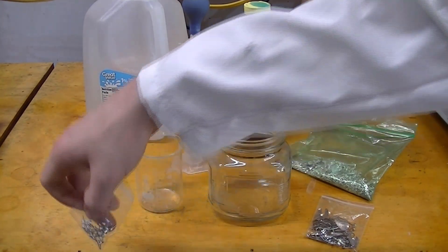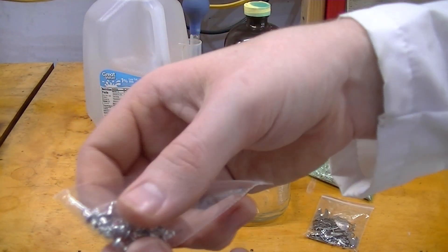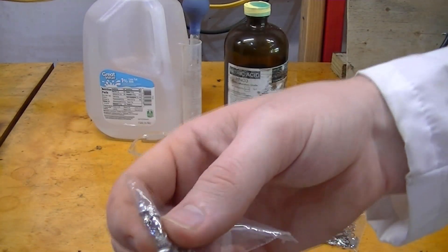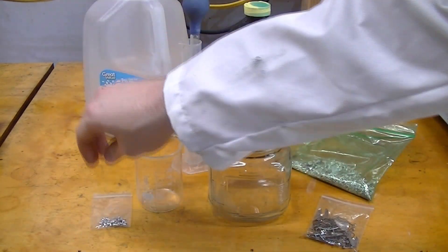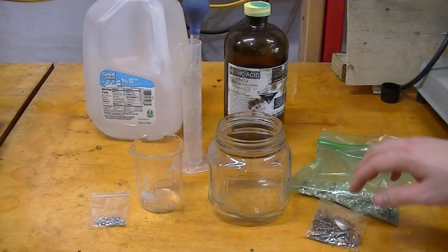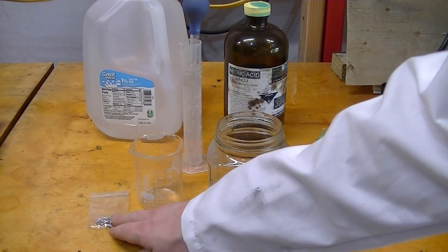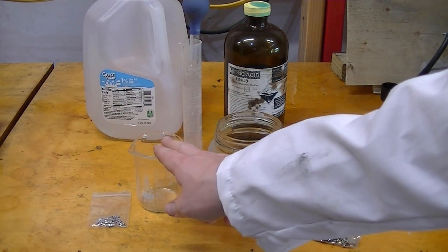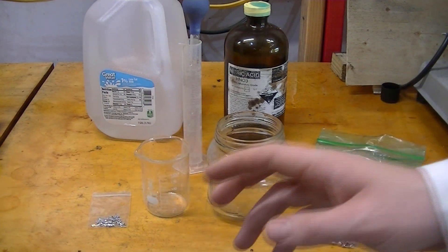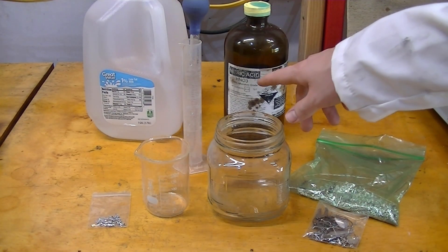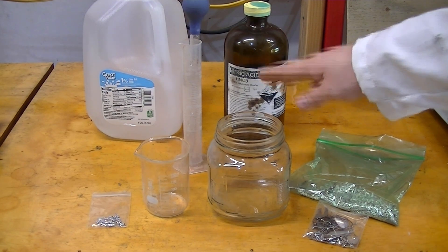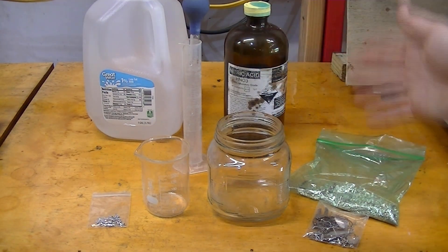And this was in the same lot, but these are earrings that have diamonds in it, so I'm going to dissolve them separately so that I can get the diamonds. What we'll be doing is putting these in here and these earrings in this beaker. What we're going to dissolve them with, though, is going to be nitric acid. This is laboratory grade stuff, so it's the real deal.